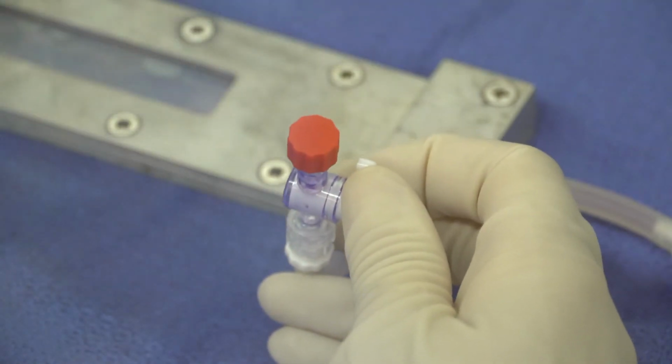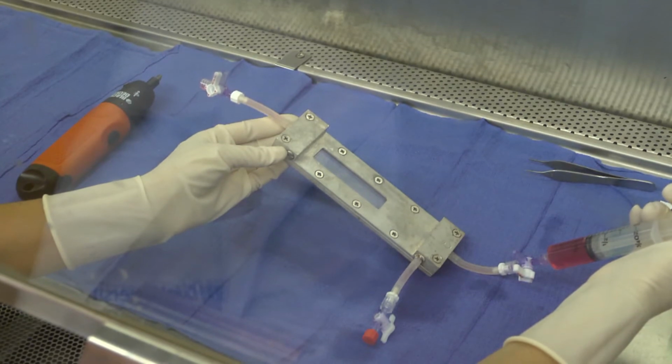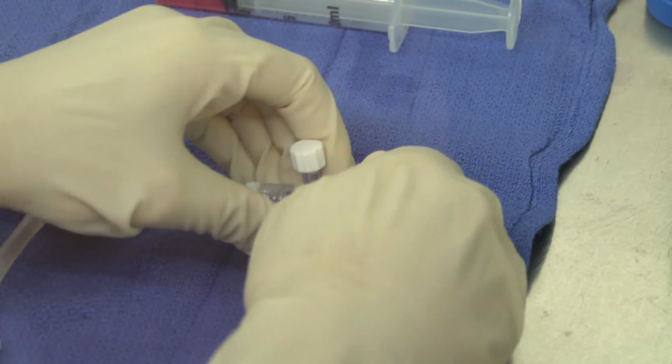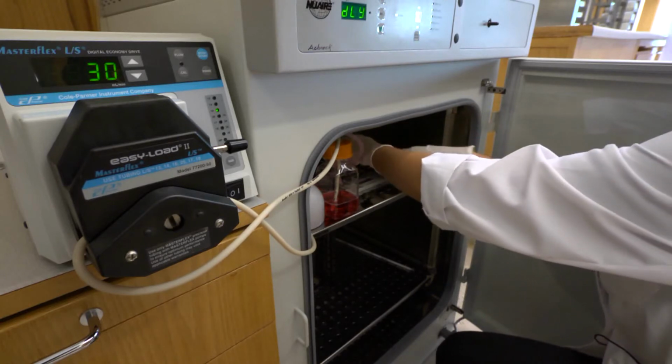and cap it. Now de-air the chamber channel by opening the outflow port 4-way stopcock and gently flushing EPC medium through the flow chamber, again using a 10 milliliter syringe. Cap all of the 4-way stopcock connections and close them off. Transfer the flow chamber into the humidified incubator with the assembled flow circuit.